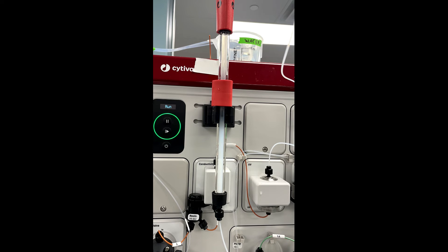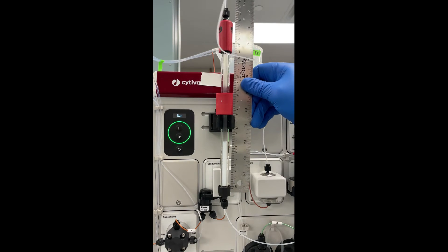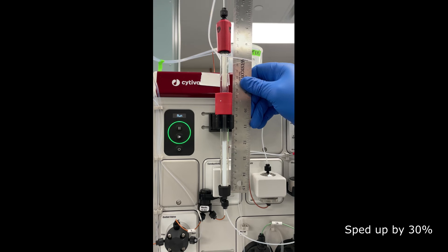This is a time-lapse of the resin bed settling. I think it looks pretty cool, I mean if you're a chromatography nerd like I am.